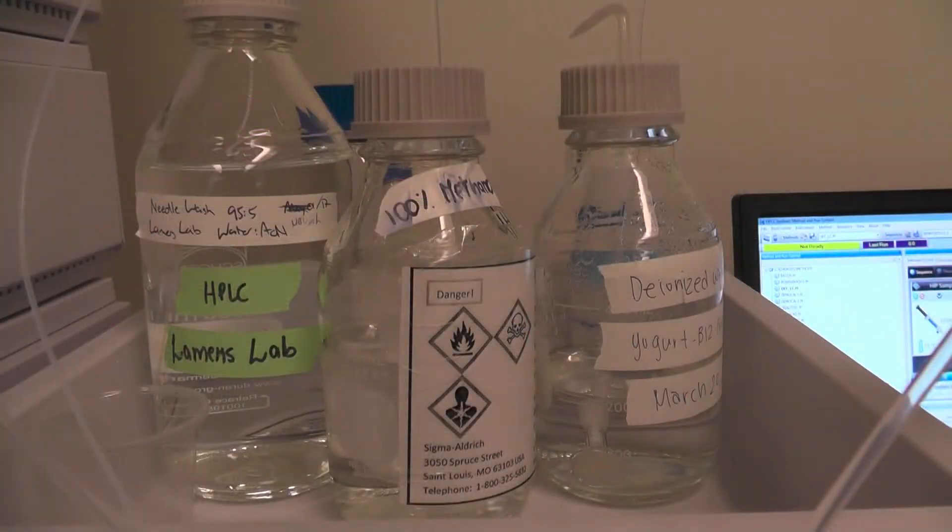Check that there is enough mobile phase in the bottles. Please note that for degassing purposes, only water or organic solvents can be used for channels B and C.